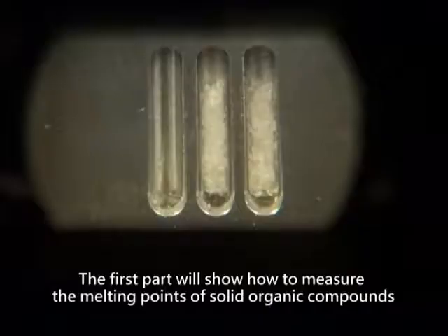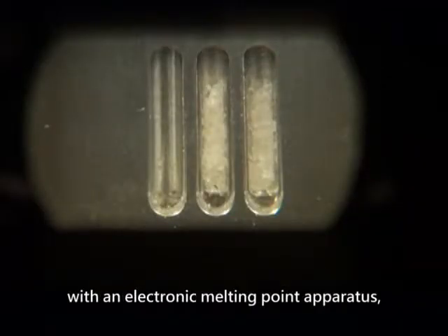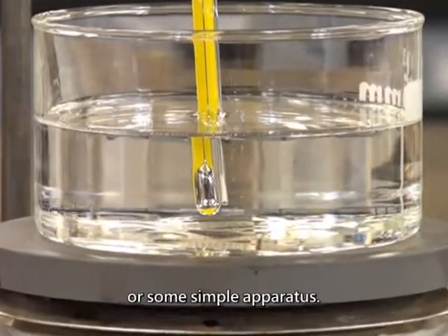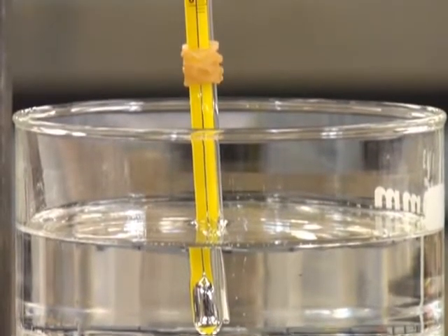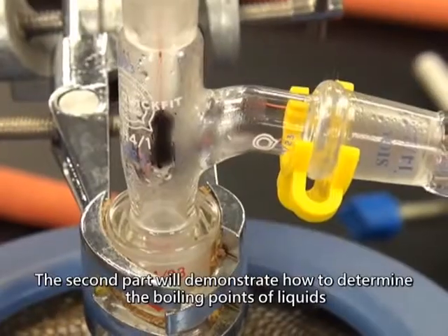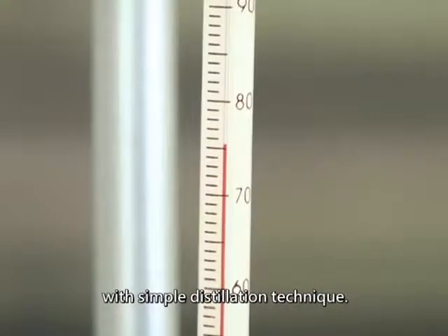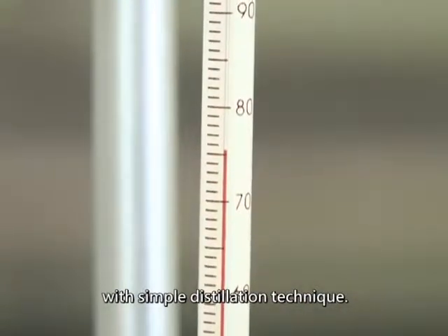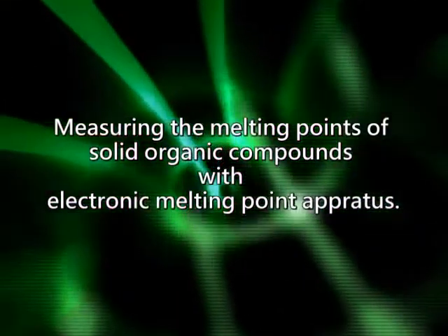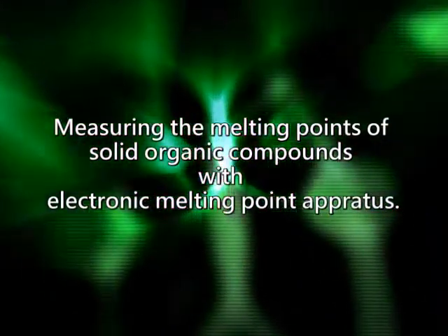This video will demonstrate how to measure the melting points of solid organic compounds with an electronic melting point apparatus or some simple apparatus. The second part will demonstrate how to determine the boiling points of liquids with the simple distillation technique. Measuring the melting points of solid organic compounds with an electronic melting point apparatus.